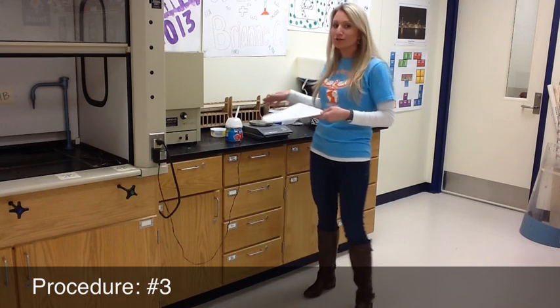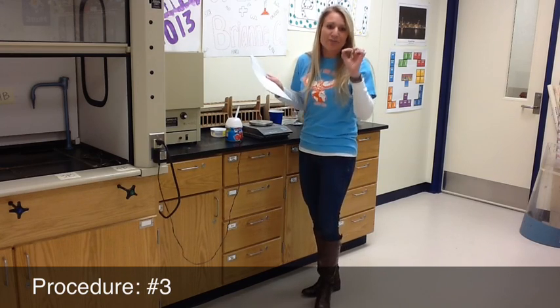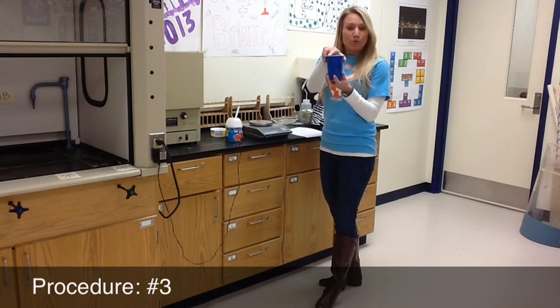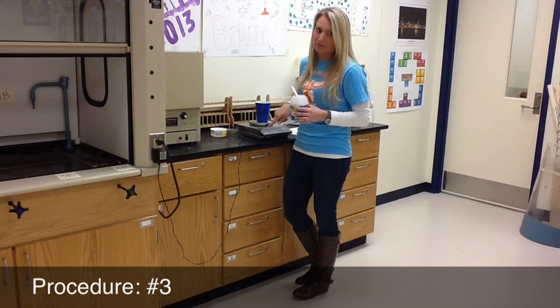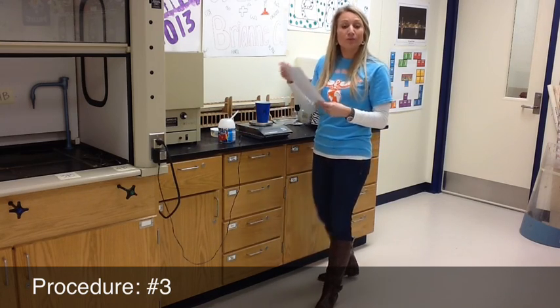Cup A, you're going to need five grams. Now our scale measures to the hundredths place, so even though it says 5.0 in the table, ours can actually measure 5.00 — three sig figs. I do not want you to take 20 minutes to get exactly 5.00. If you get 5.02, you're good — just make sure you record 5.02 and cross out 5.00. If you get exactly 5.00, make sure you add a zero so that you have three sig figs for your calculations. You need your A cup when you come to the back to get your Kool-Aid. Put it on the scale, press zero so we don't weigh the cup, then add scoops of Kool-Aid until you reach 5 grams. The same goes for 15.00 grams for cup B and 30.00 grams for cup C.